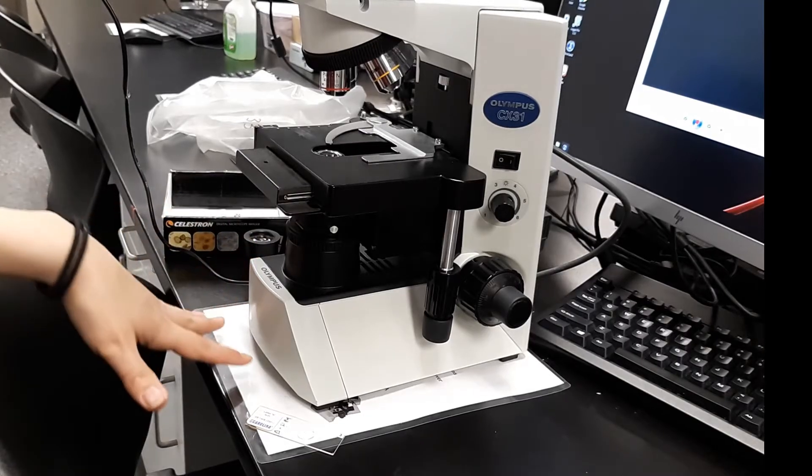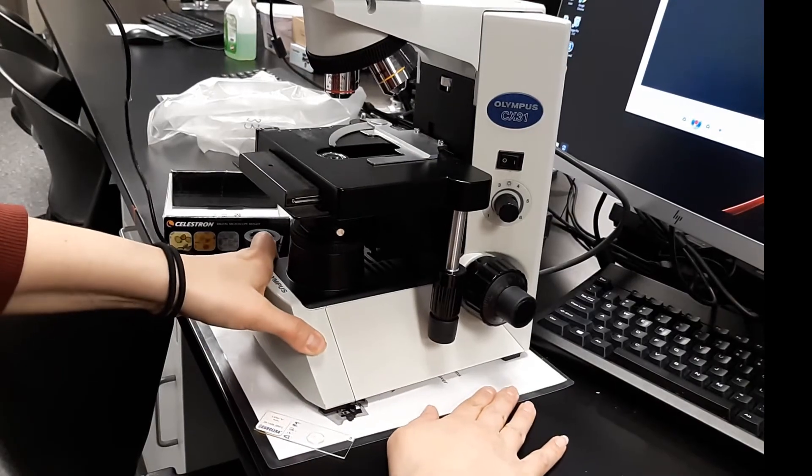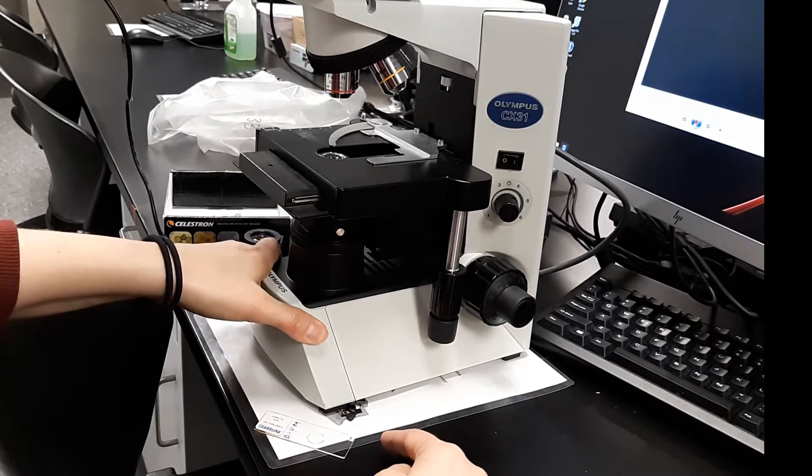Next, you're going to make sure you're putting it on this laminated plastic paper. That allows you to rotate the microscope without damaging its feet or your desktop.